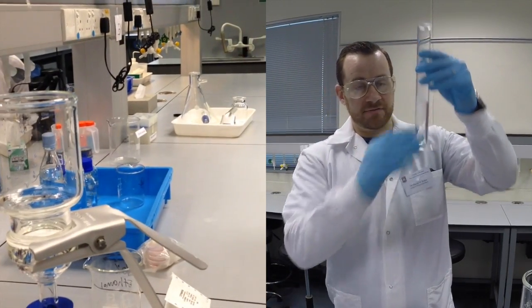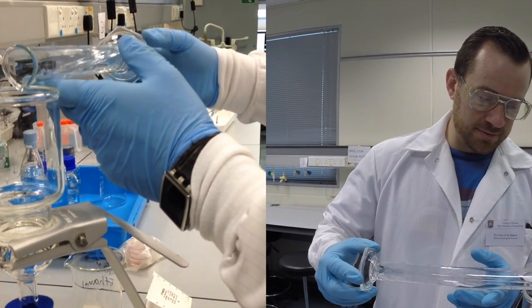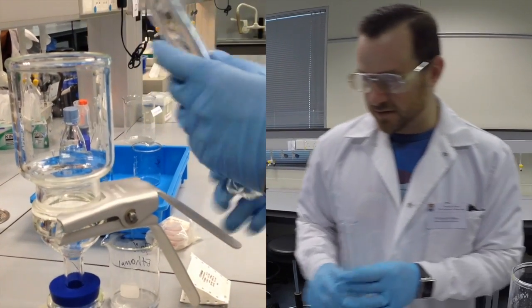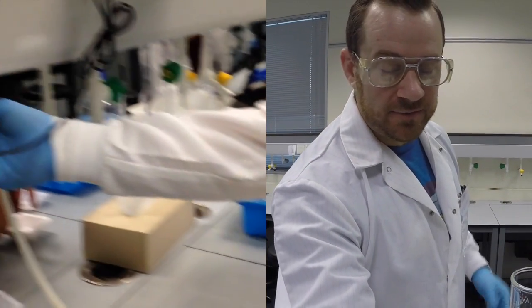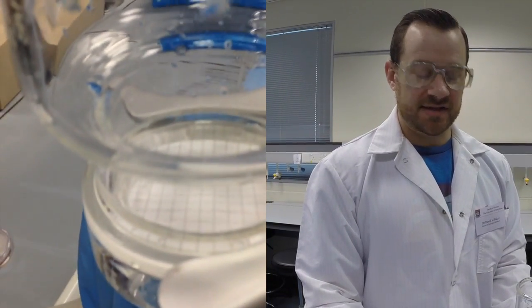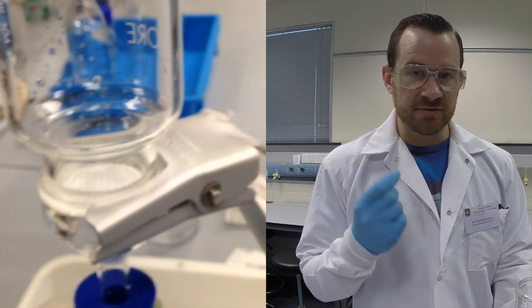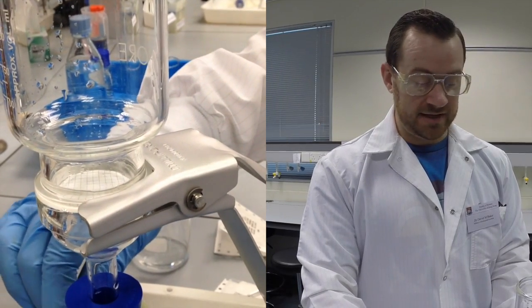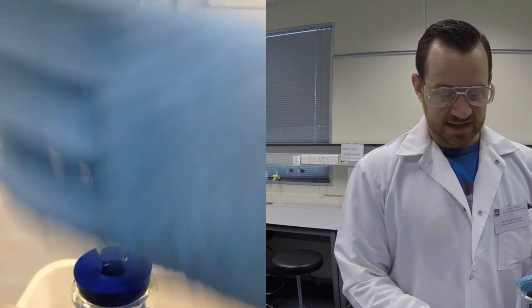I would make note of the volume and record that in my lab notebook, and then I will filter this slowly through my membrane filter. Very easy. Once the solution has passed through, the liquid has essentially been separated from my microbes. My microbes are now stuck on the surface of the membrane. And you can imagine them as single cells or single small groups of cells that will slowly grow on the surface of that membrane once I give them a proper environment in which to grow. So I'm going to take this apart again.